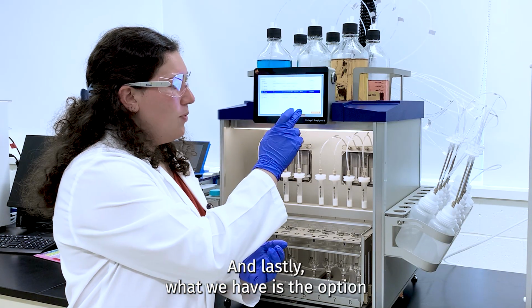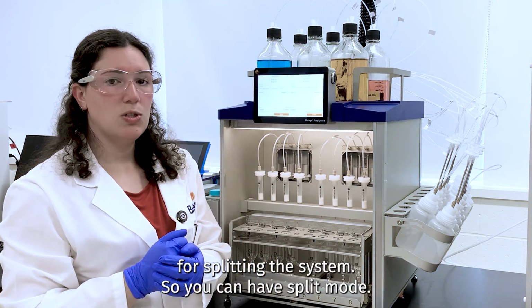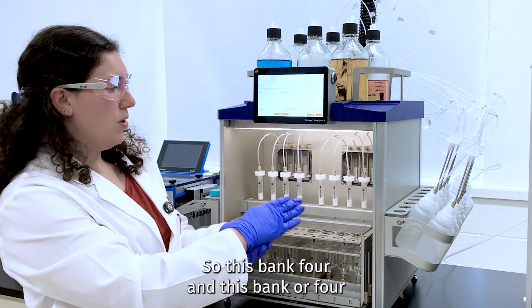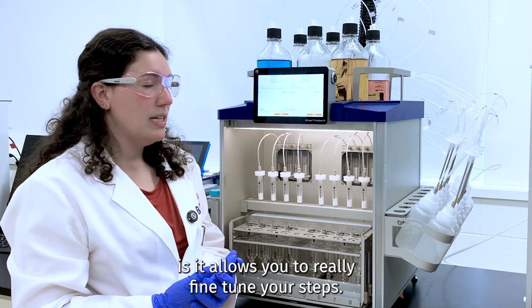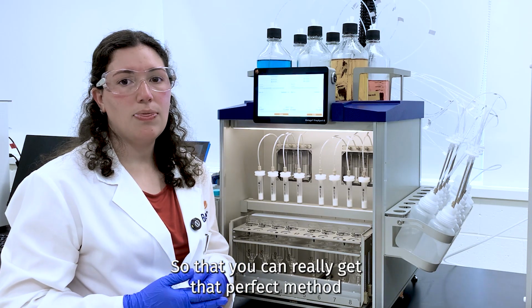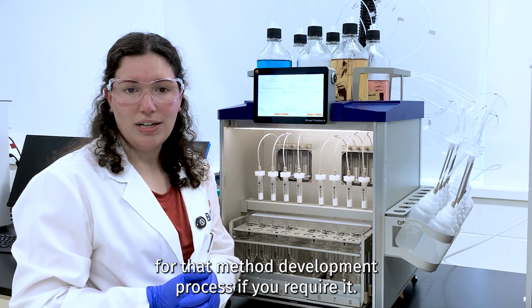And lastly, what we have is the option for splitting the system. So you can have split mode. So this bank of 4 and this bank of 4, you can have run 2 separate methods. Now, why this would be really beneficial is it allows you to really fine tune your steps so that you can really get that perfect method for that method development process if you require it.